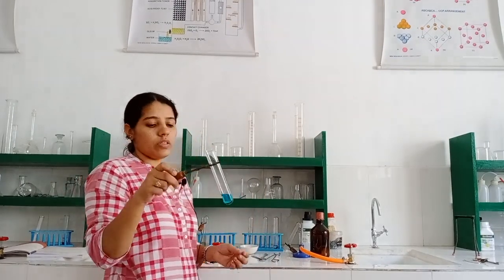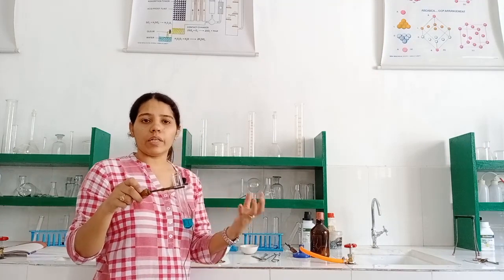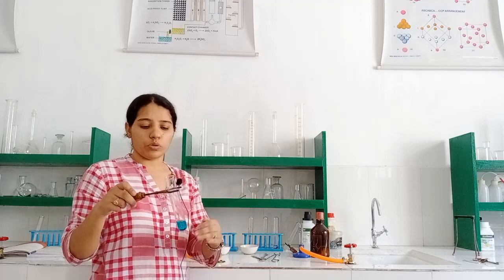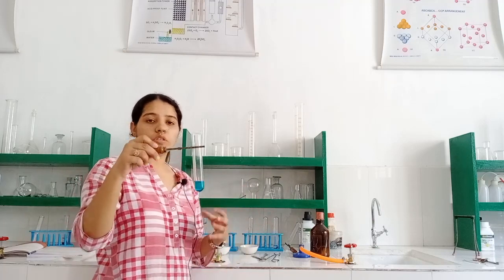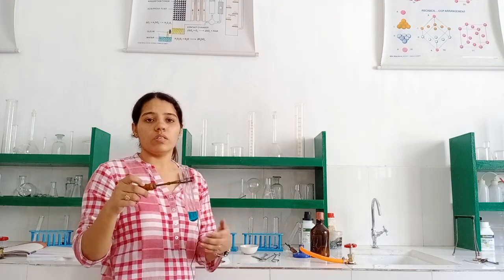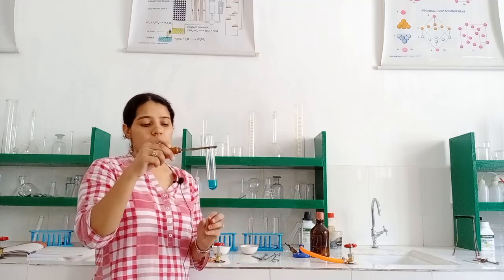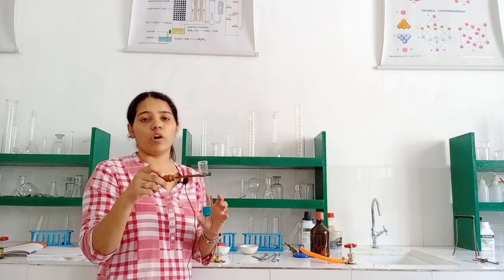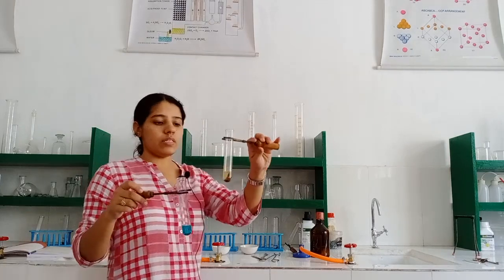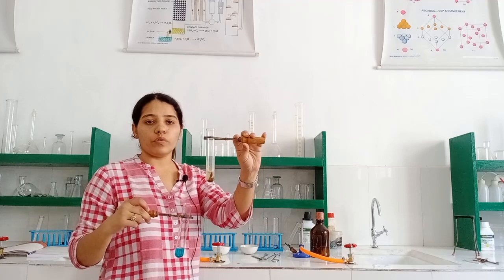So what will happen after 2 or 3 hours? It is not an instant reaction. It will take some time, approximately 3 to 4 hours to show the reaction. So after 2 or 3 hours, what will happen? The displacement starts taking place. Displacement of what? The iron nails are able to displace the copper from the copper sulphate solution, and when the displacement has taken place, you can see this solution appears like this after 3 or 4 hours.